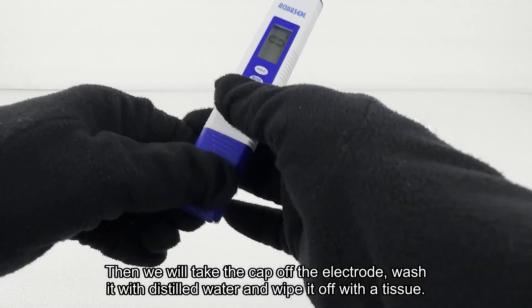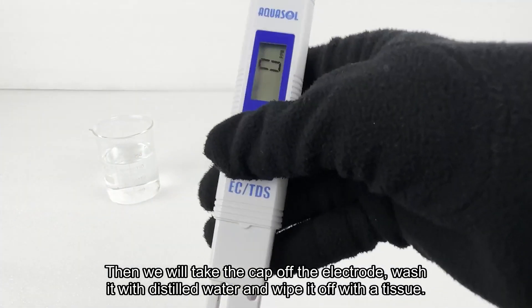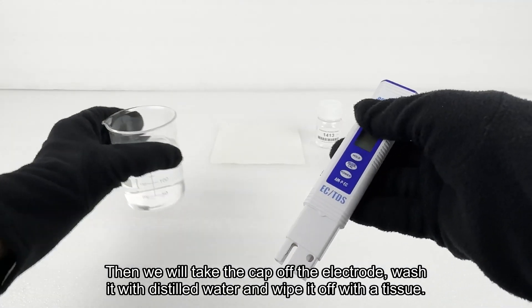Then we will take the cap off the electrode, wash it with distilled water and wipe it off with a tissue.